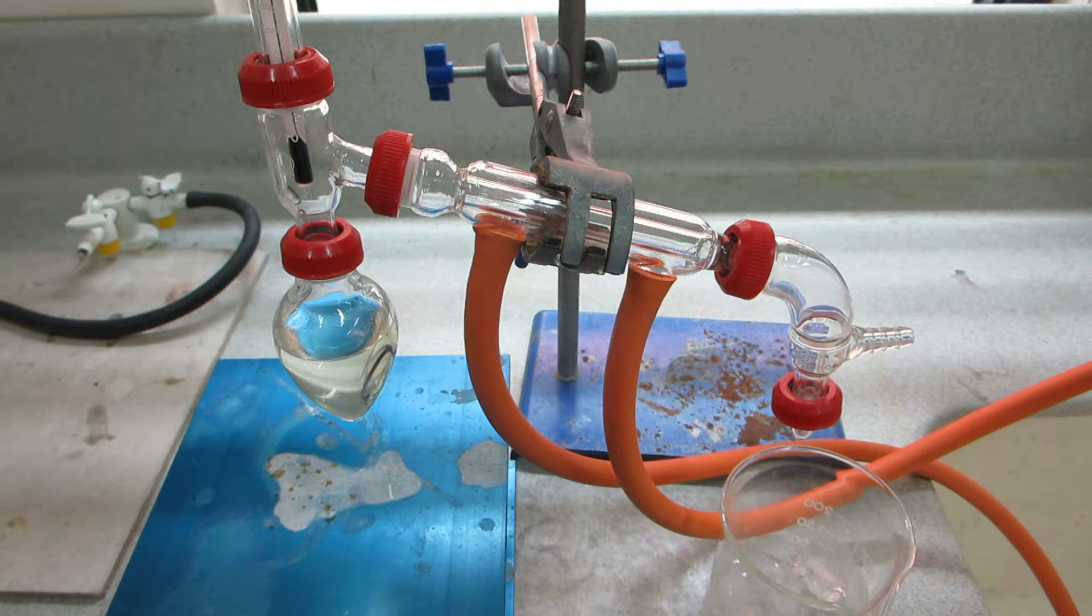Well, this reaction is exothermic, but we need to give it a little start with some hot water. A little kick at the start. And we do that with hot water.